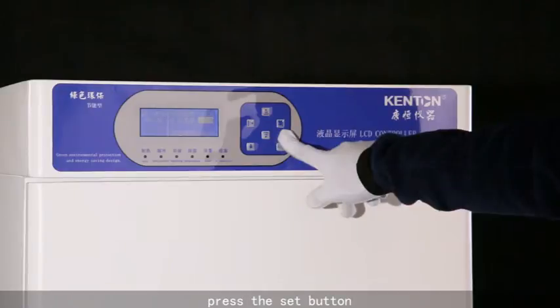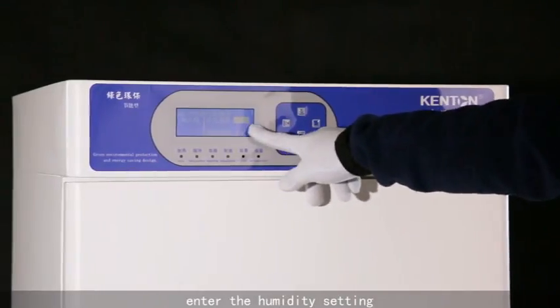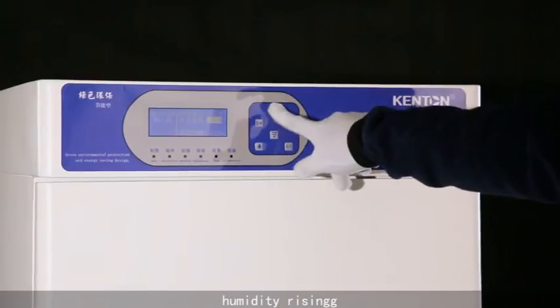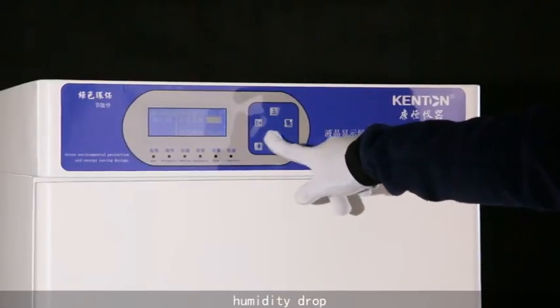Press the set button. Enter the humidity setting. Humidity rising, humidity drop.